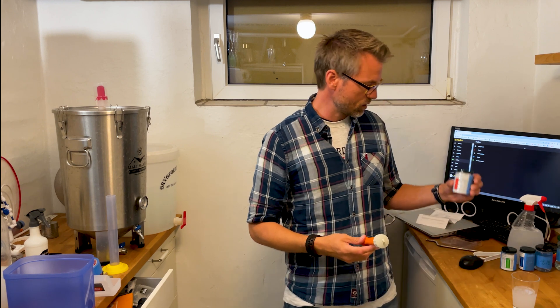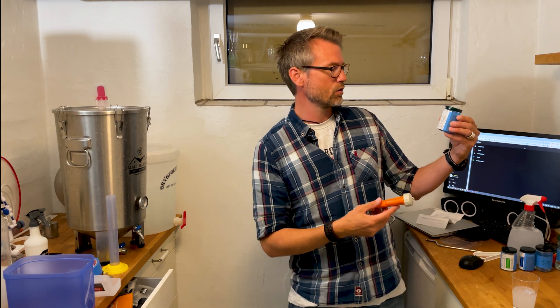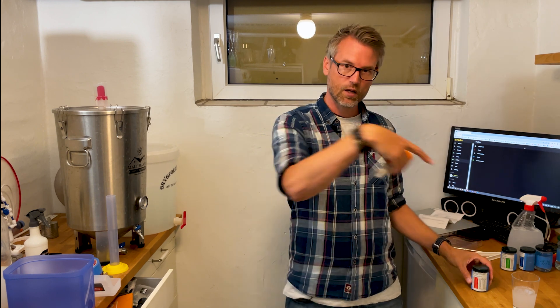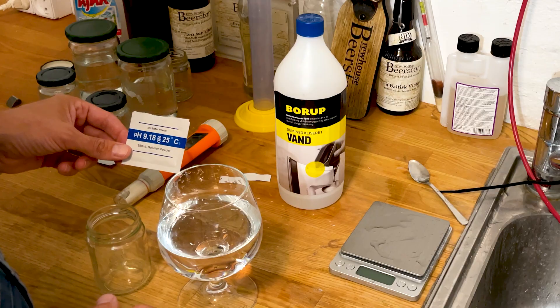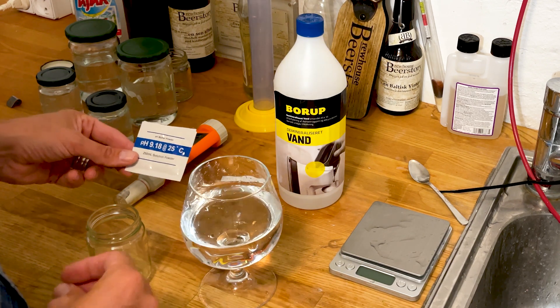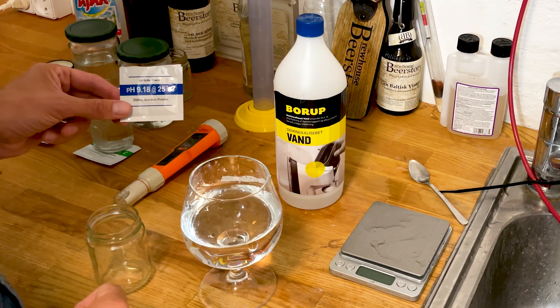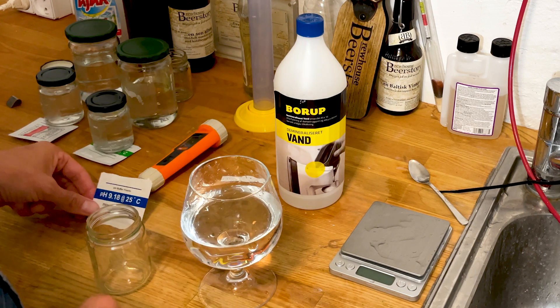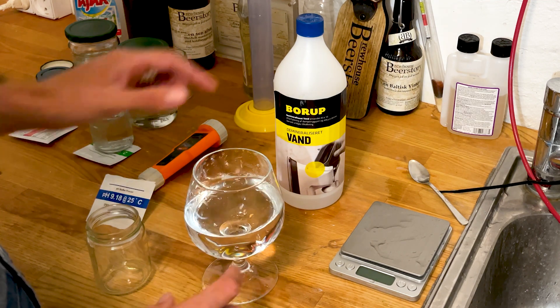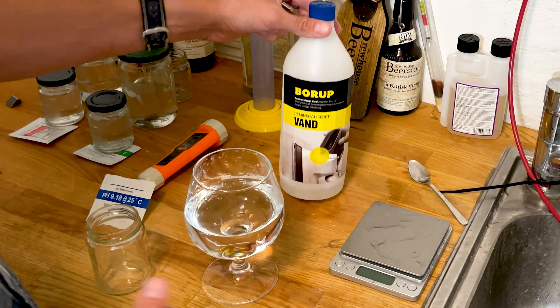When you buy it there's a buffer powder solution that you have to make. You can see right here how I've made it. The way I make this calibration solution is I take this pH buffer powder and put it into 250 milliliters of deionized water.